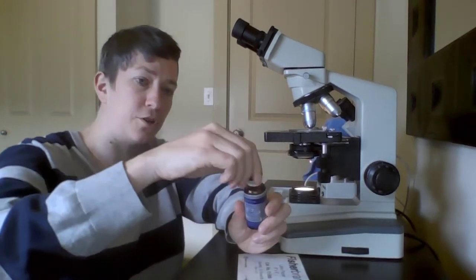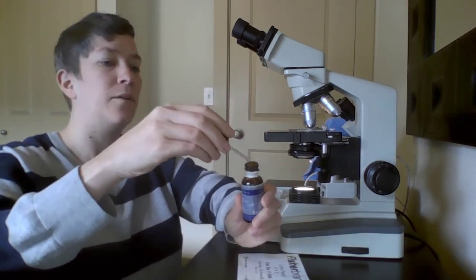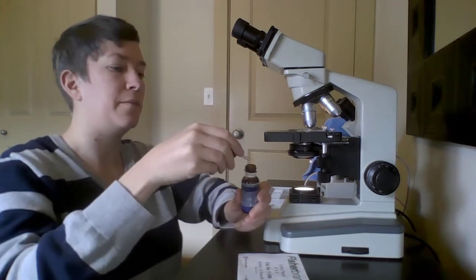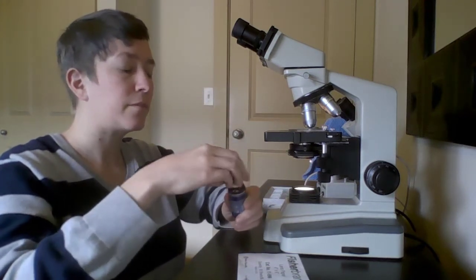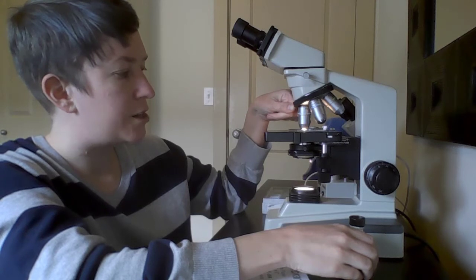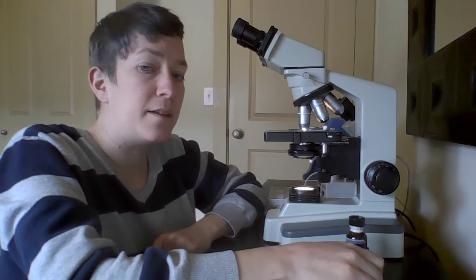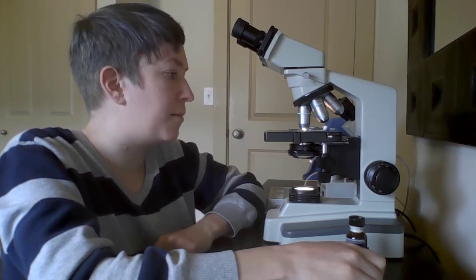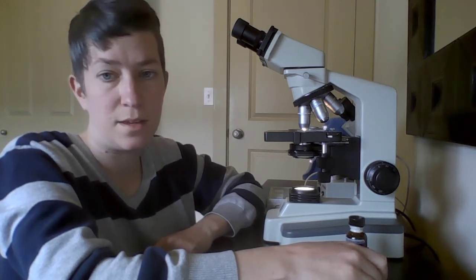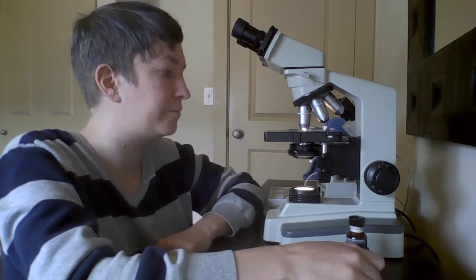And then we're going to take this immersion oil. You can see that it's very oily. And we're going to put a drop of that onto the slide on top of our specimen. Then you're going to move all the way over to the 100, and the lens will touch the oil, which is touching the slide. That's going to cause the light to pass through the oil into the lens, and that will improve the refractive index so that you can see the correct non-blurry specimen that you're looking at, and it should be the right color.